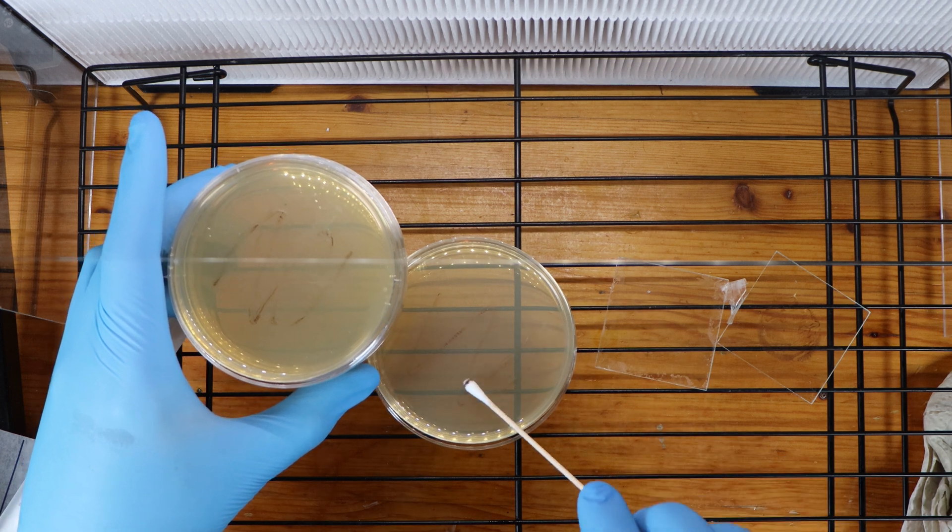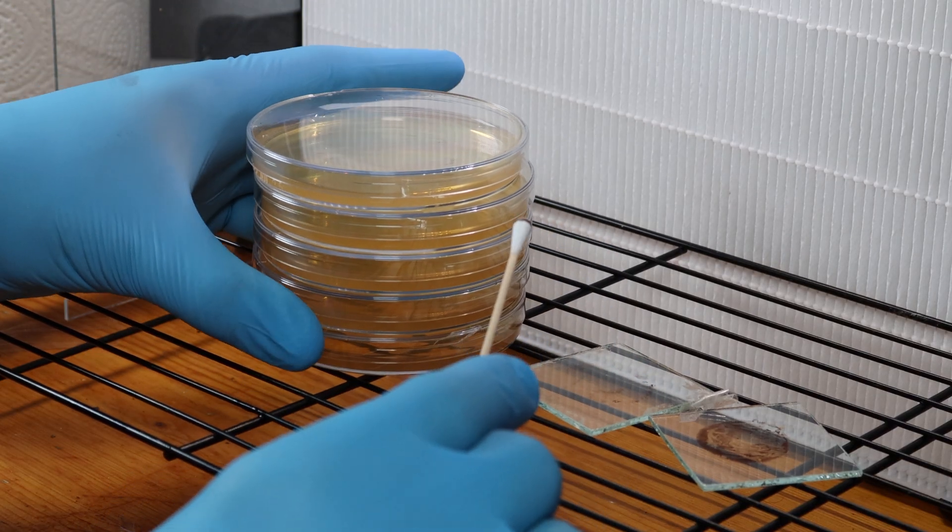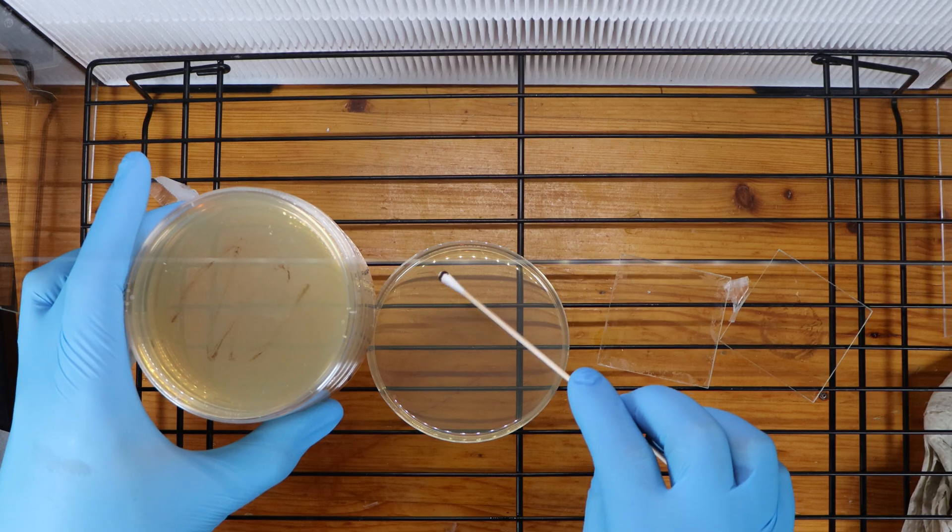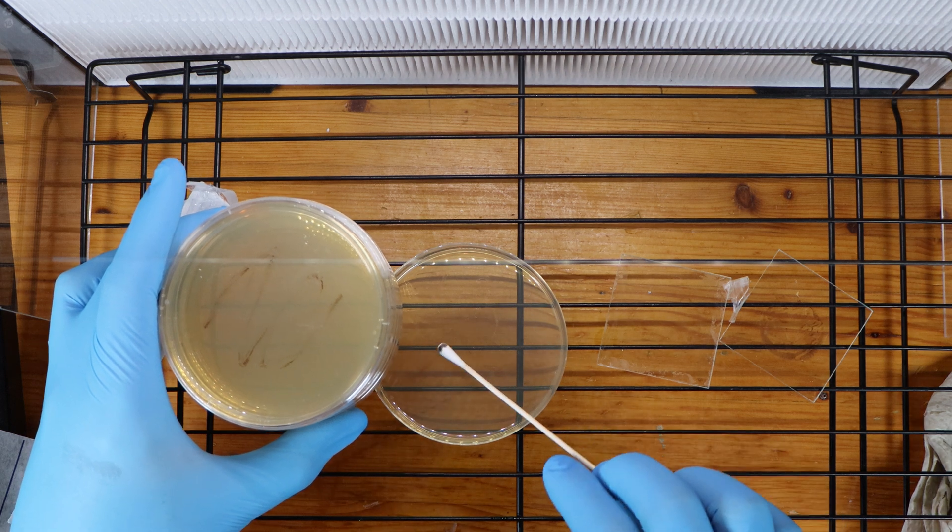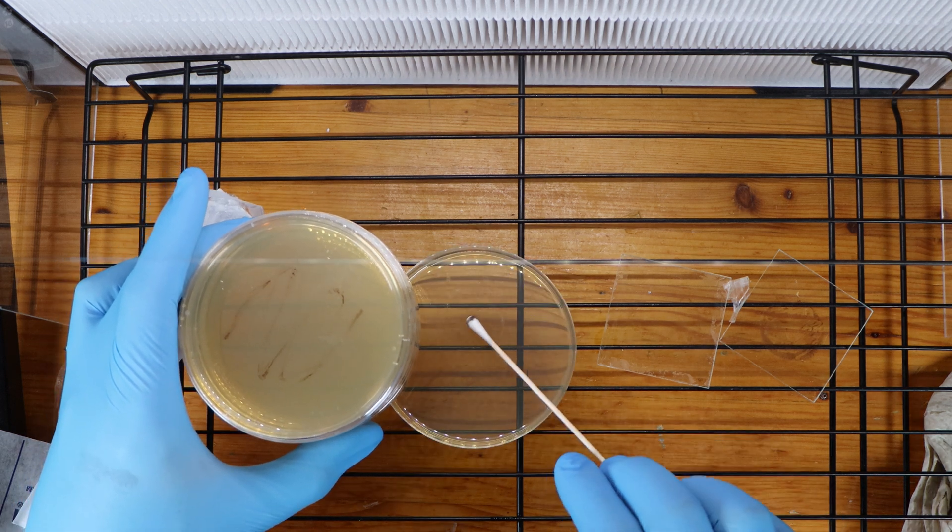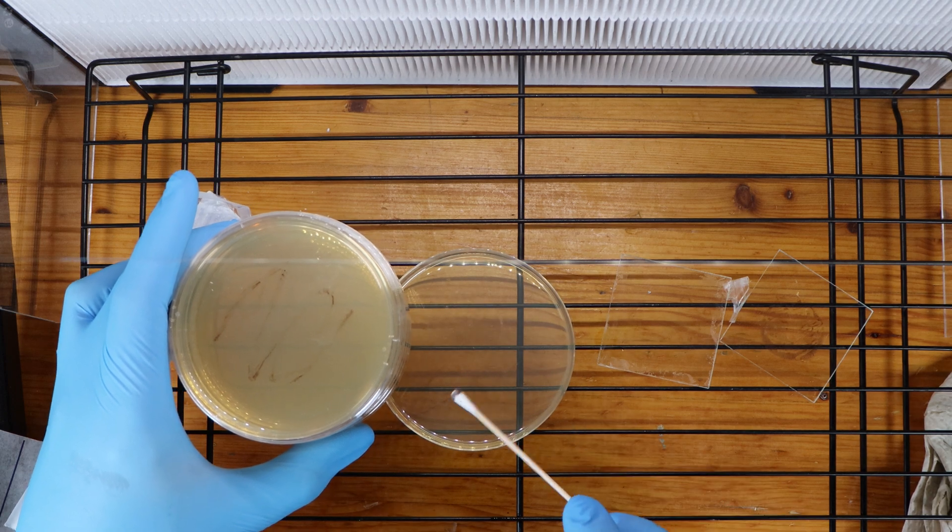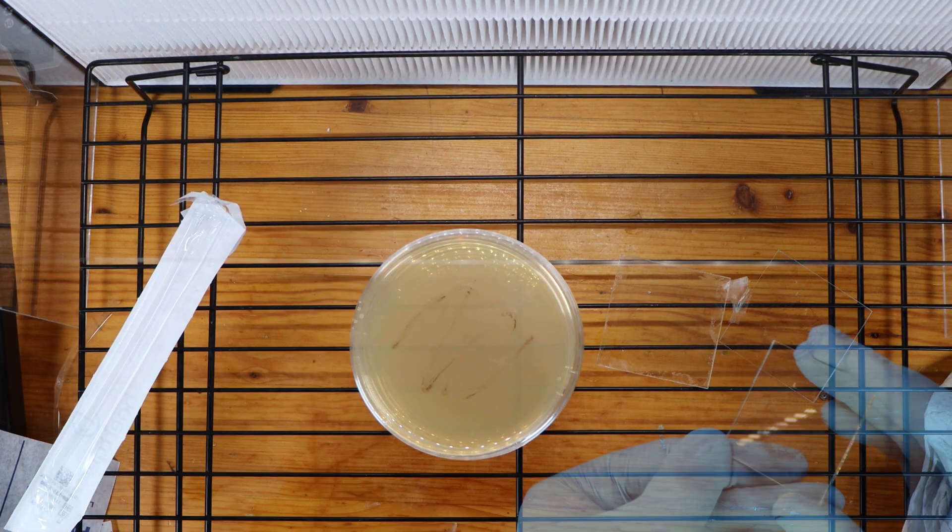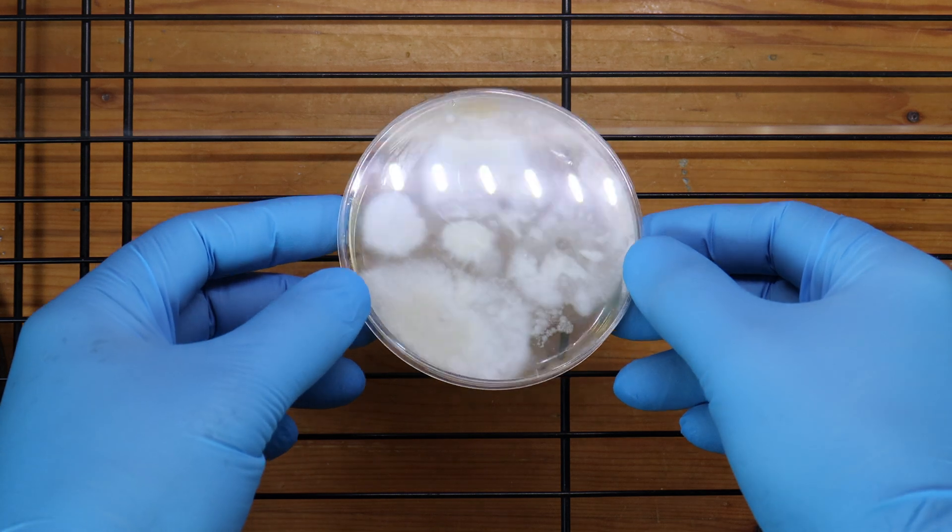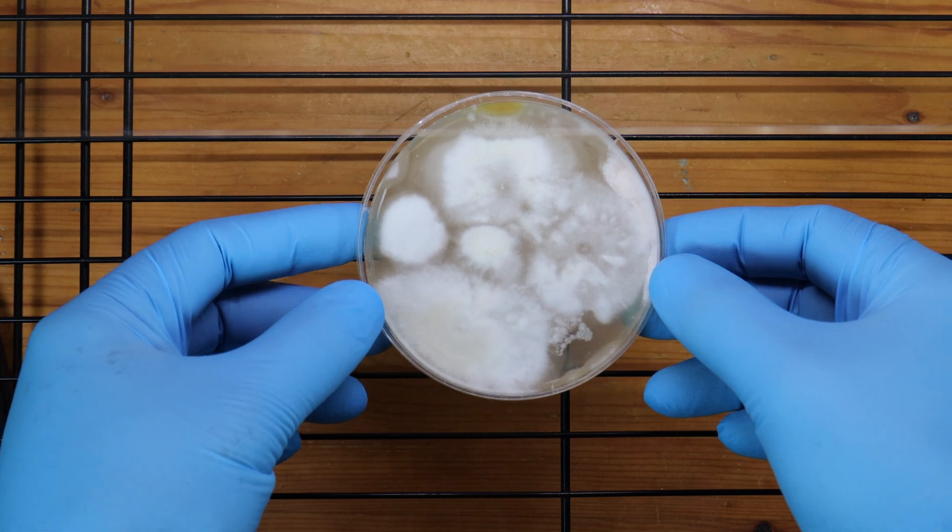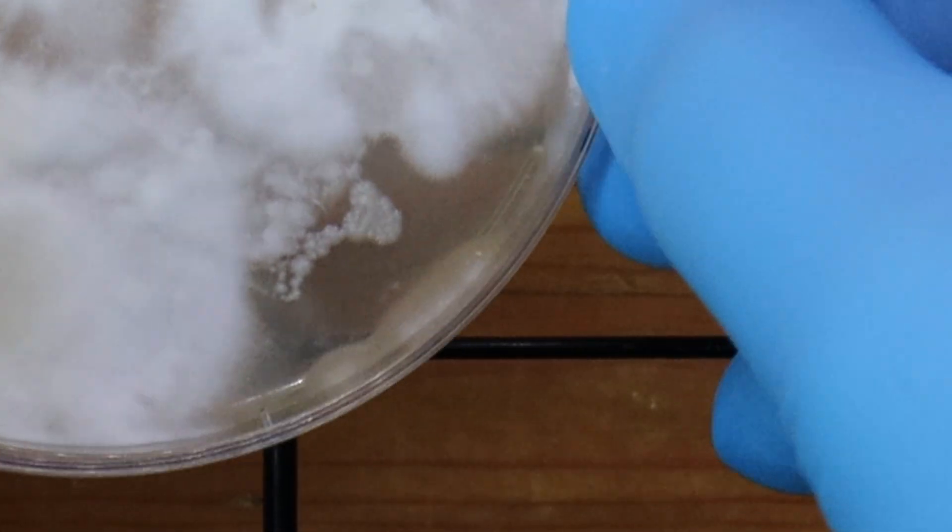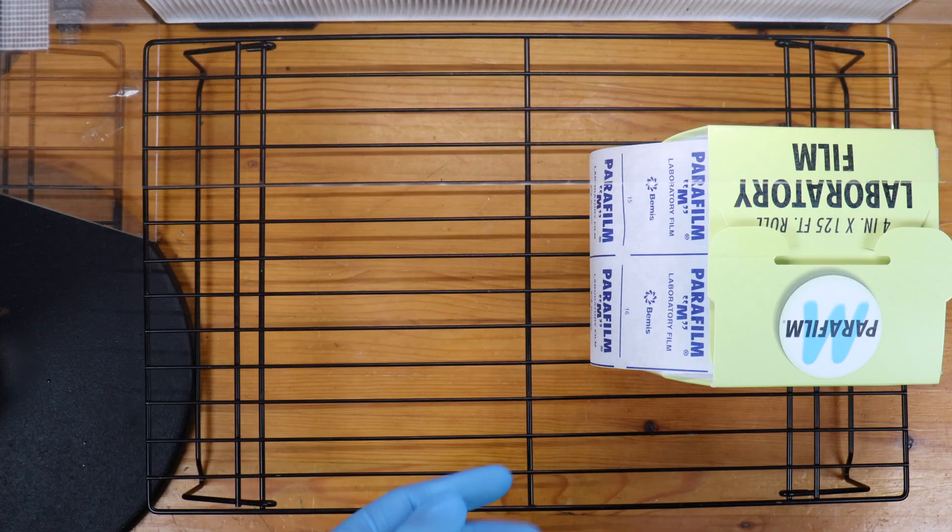And before you know it, you've got plates ready to be sealed and incubated. Beautiful. Unfortunately when sealing my petri dishes, I sealed them off camera and you couldn't really see what I was doing. So I have here a contaminated plate from an earlier batch that I've opened, and I'm going to reseal it in this here dramatic reenactment.